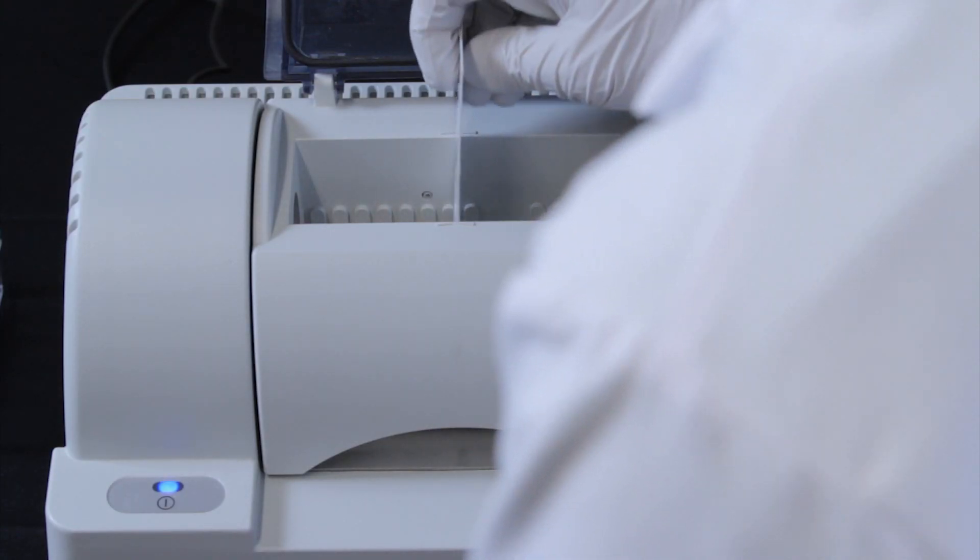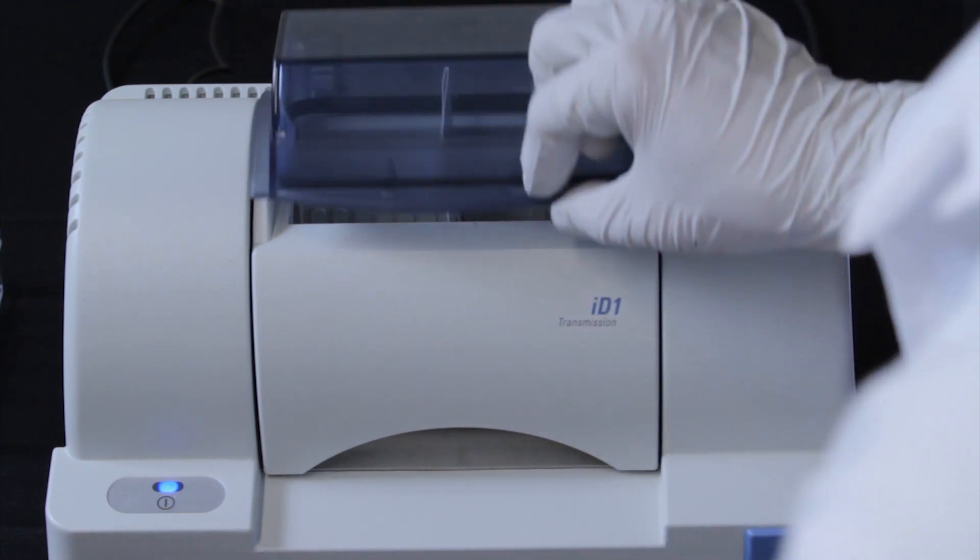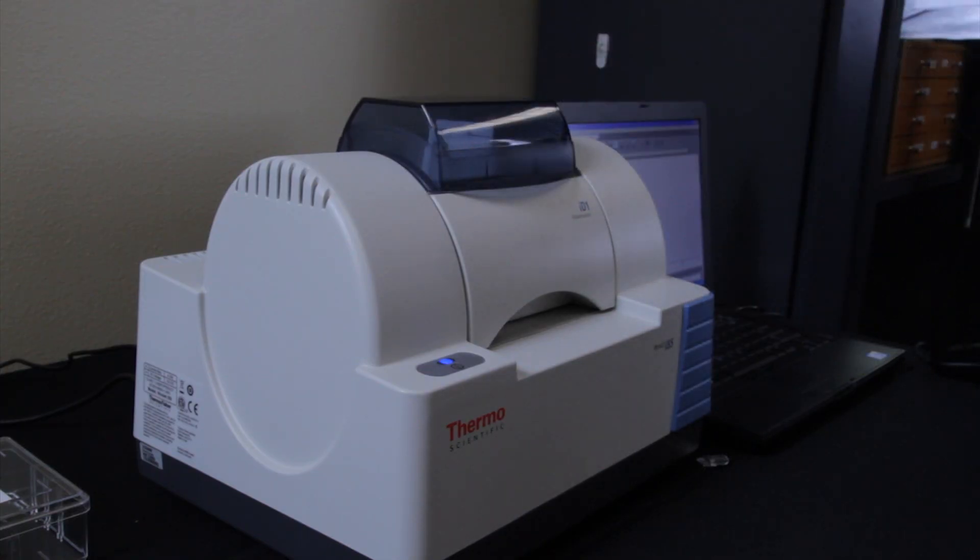We place it into the ID-1 accessory, close the lid, and then start the analysis.